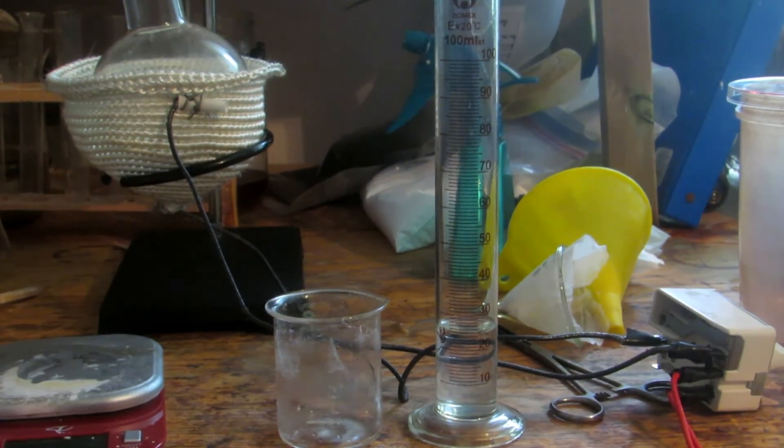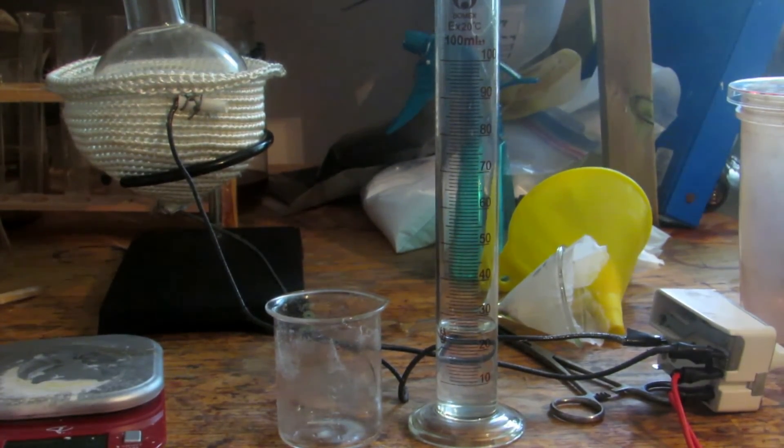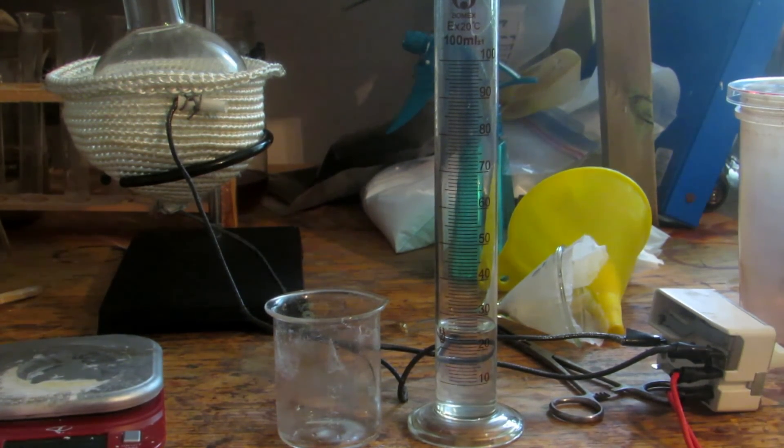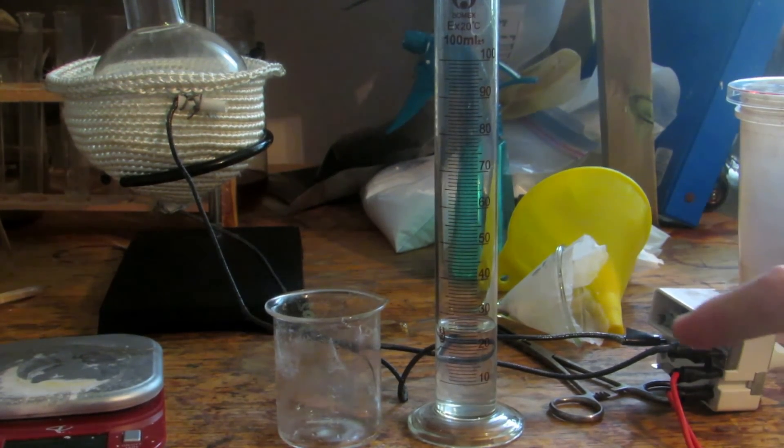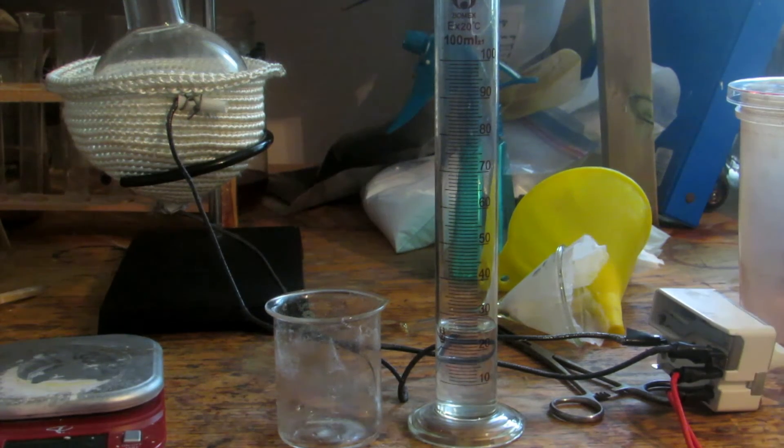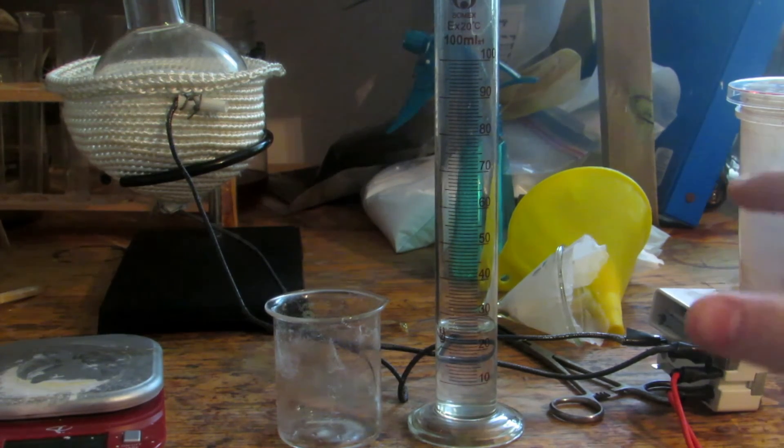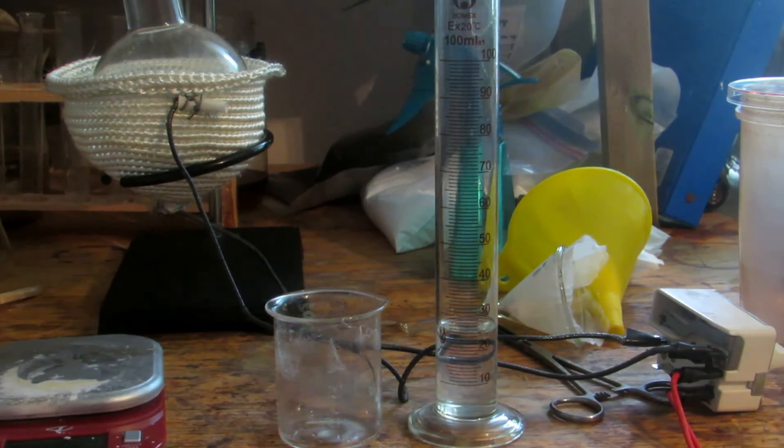At 25 milliliters, there's probably still about a gram of potassium iodate dissolved. So I'm going to boil this down to about 10 milliliters. At 10 milliliters, potassium iodide is still soluble at about 12.8 grams per 10 milliliters even at 0 degrees Celsius, so the potassium iodide will stay in solution. However, the potassium iodate would only be about 0.4 grams in solution, making it much more pure.